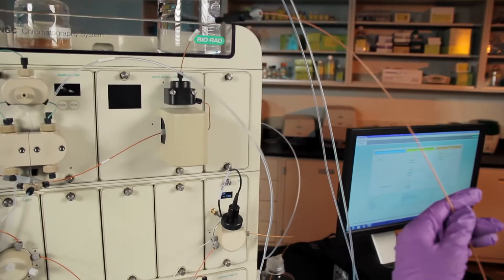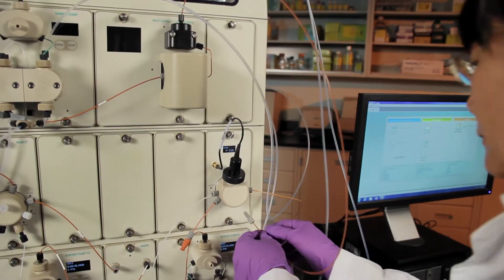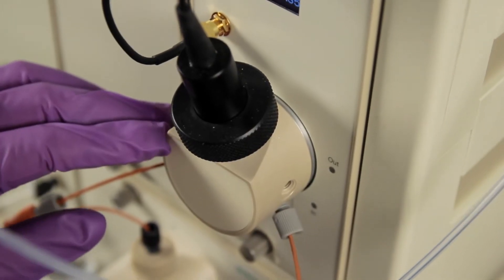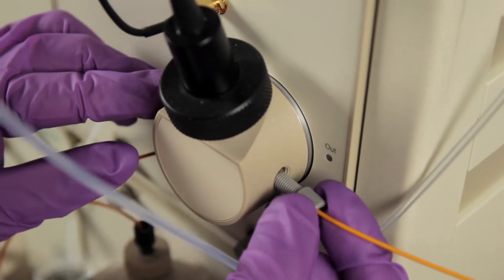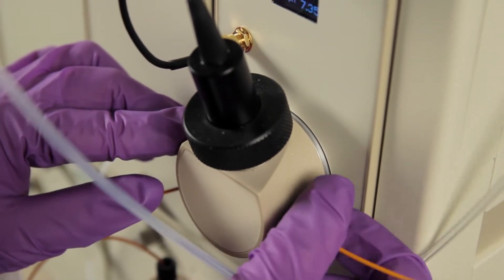The NGC-PH valve module provides in-line, real-time monitoring of buffer pH, allowing for successful protein separation while ensuring stability of your sample.